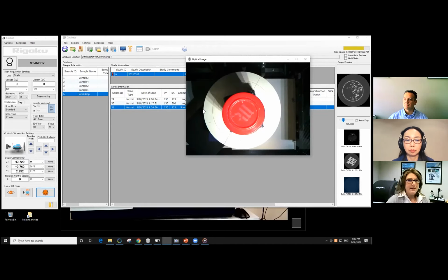What happens, however, if you chose an alternative one that we showed you? Well, for the first one, if you were to choose the metal container, just like you might suspect, you're going to get artifacts, metal artifacts that you can see all around here. Also, the metal is highly absorbing, and we can't see the edge very clearly at all. If instead we use glass, glass is highly absorbing, and it absorbs more than the stuff inside, the organic material, so it appears more faint.